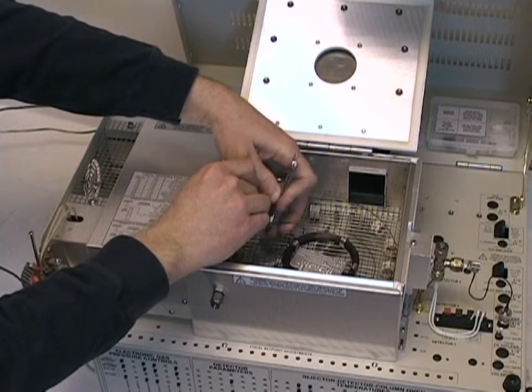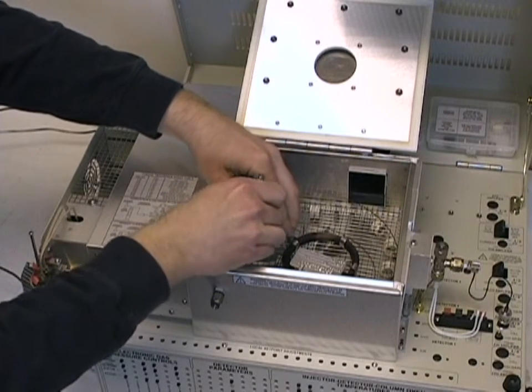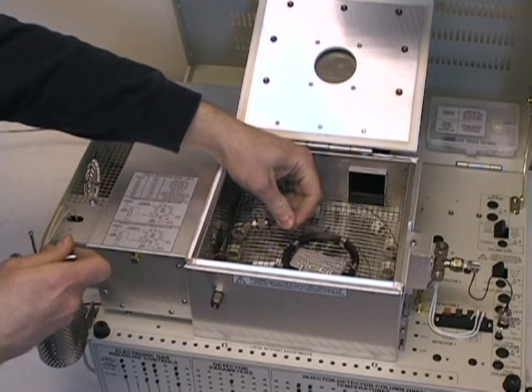To check the tightness of the fit, if you grab the end of the column and give a gentle pull, it should not move. If so, push the column back in and retighten.